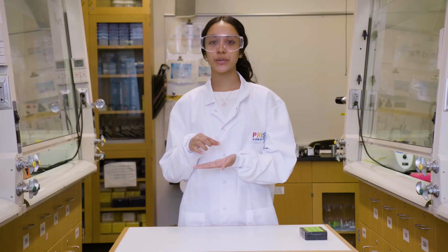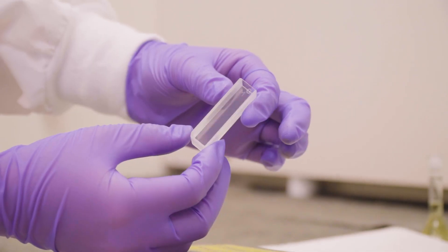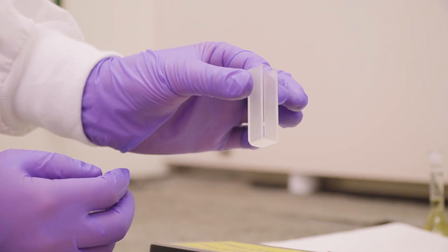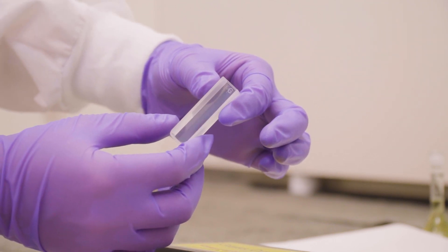Welcome to this instructional tutorial on how to properly clean and use a cuvette for UV analysis. Ensuring a clean cuvette is essential for obtaining accurate and reliable results. First, let's focus on the cleaning process.